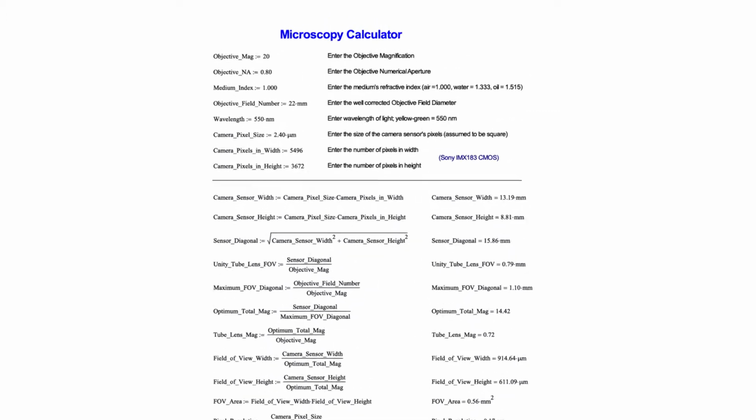About a third of the way down the page is a horizontal line. That basically divides the spreadsheet into things that are above the line, which are the parameters of a particular optical system, and the elements below the line, which is where we calculate the consequences of those parameters. So let's walk through it.